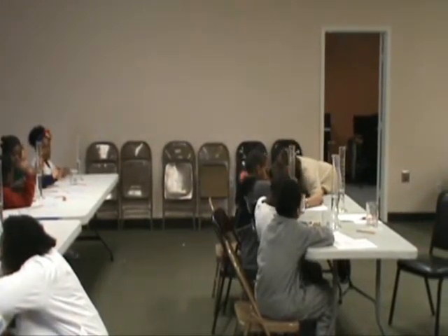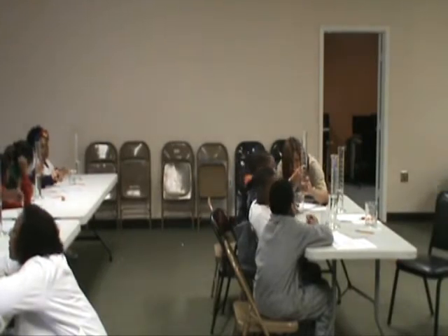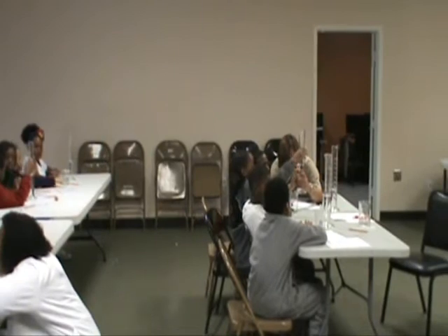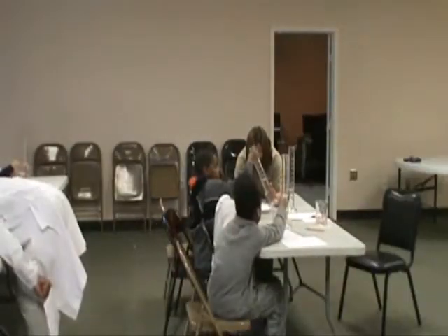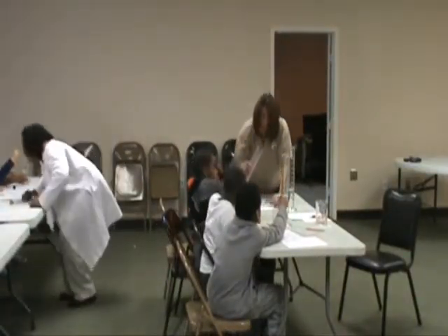Okay, let me see. You guys are above 250. Come here. Look right here. You see 250? Look, the long line. You see this long line? Look how far up you are. It's okay. Watch this. Oh, I don't have a long one. So, this is not long enough. So, no, you can't use your hand.